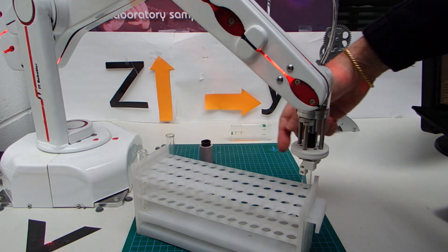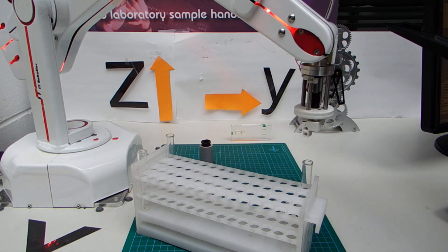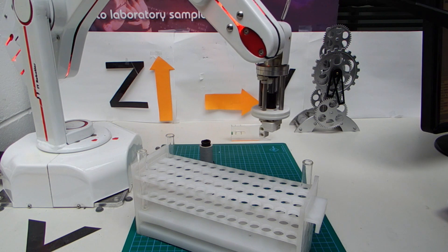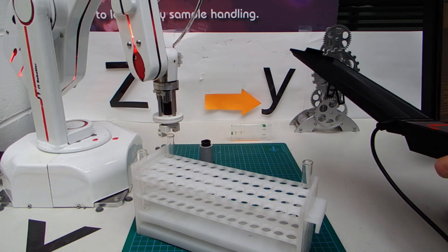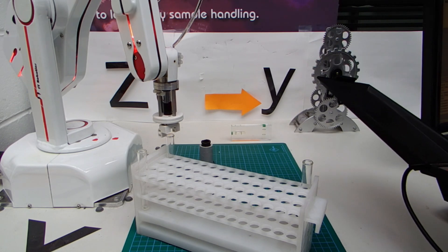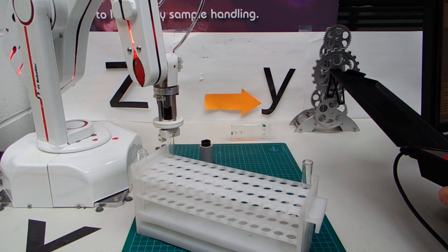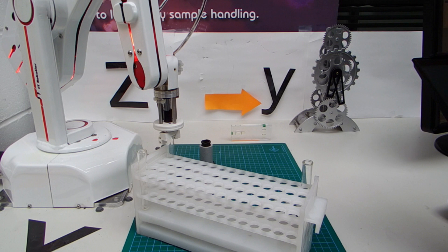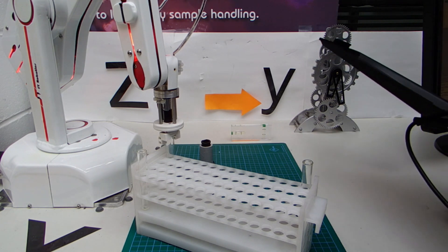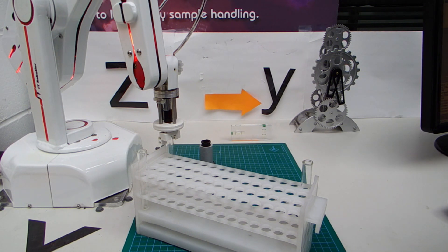Next I will move up to the other end of that row, which is position 15 in the grid. On 25mm increments I will move up and across on Y. It's harder to get to because the rack is at an angle. Switching to 1mm increments. And then do a trial grip. That's the satisfactory corner of the grid, so we click line 15 on the screen and click set to here.